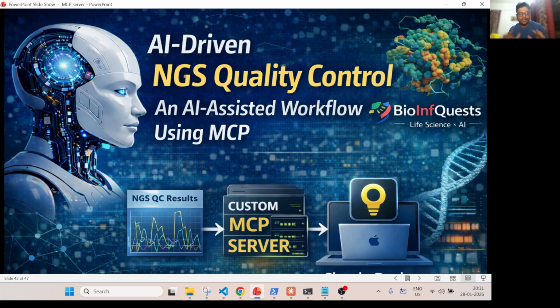Hi everyone. In this video, we will do a use case where we will build an MCP server for NGS data quality control. Then we will connect to that MCP server our Claude Desktop, the AI assistant, and using the AI assistant we will do the NGS QC analysis. So you can think that we are building an AI-assisted NGS quality control workflow. That's the main idea behind this.